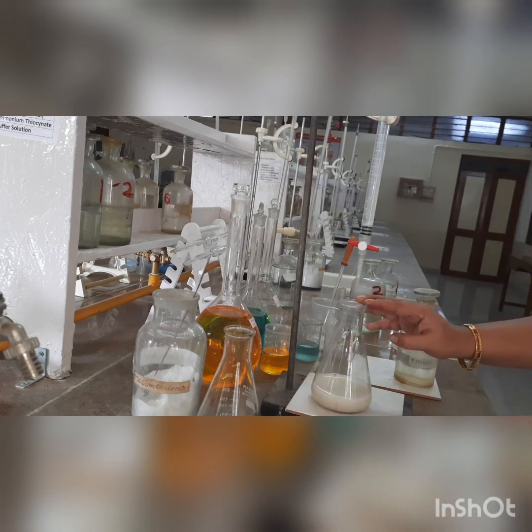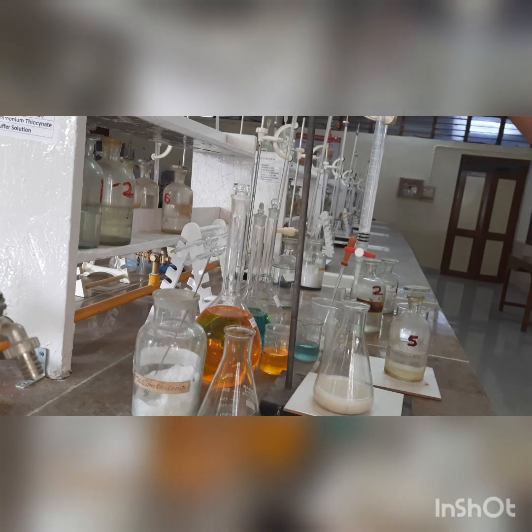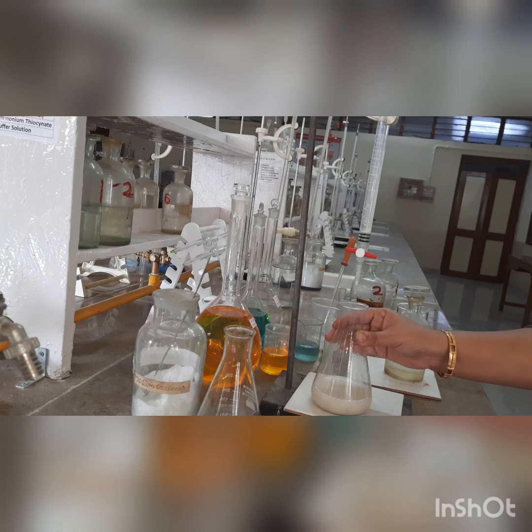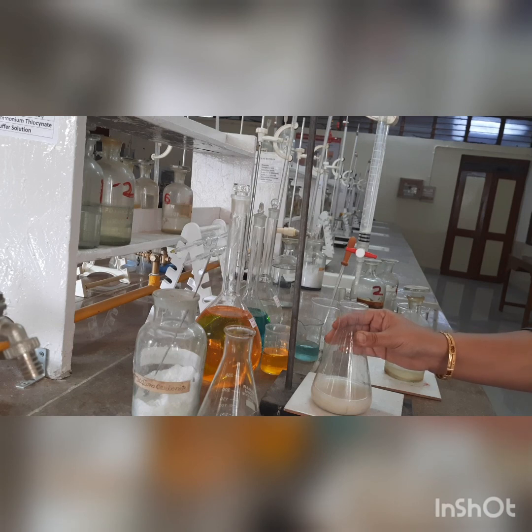We let the solution rest even after the end point and we added ammonium thiocyanate at the end to ensure — and now we are again getting white, there is no blue coloration, therefore it means that the titration is over. This is the first reading — we will note the reading after taking the burette out of the stand. The reading comes to around 22.7, so the second part reading becomes 22.7. We are going to repeat the same titration and do it till we get concurrent readings. The minimum concurrent value will be the end point of the second part. So we have got two readings — the first end point goes in the first observation table, and the second end point goes in the second observation table.